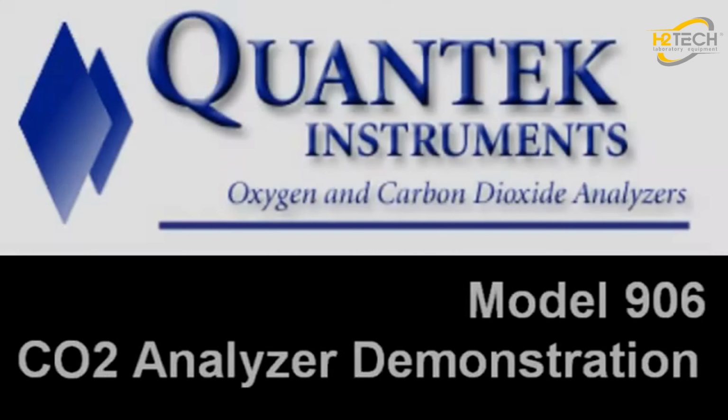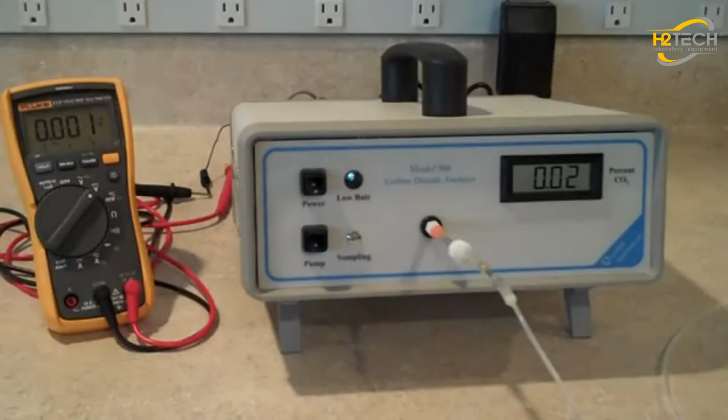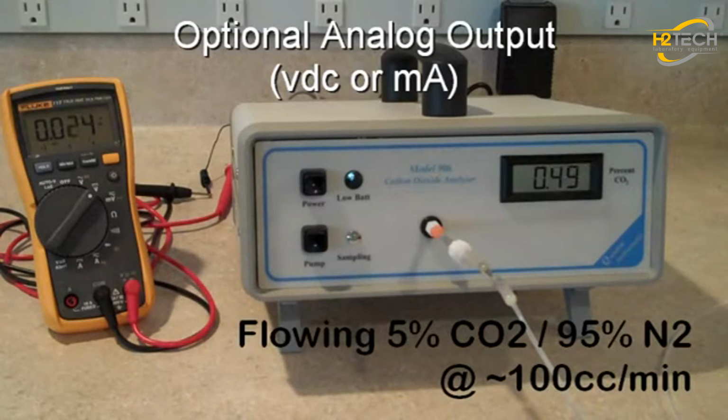This is a short video demonstration of the QUANTEK Instruments Model 906 CO2 analyzer. We've equipped it with our optional VDC analog output on the back and connected it, as you can see on the left, to our Fluke voltmeter in the lab.